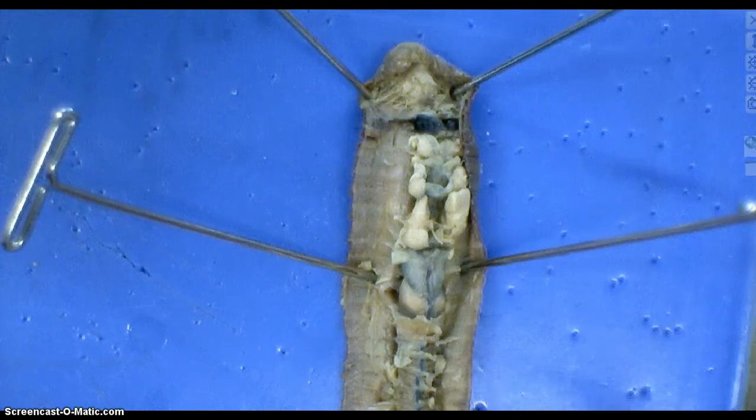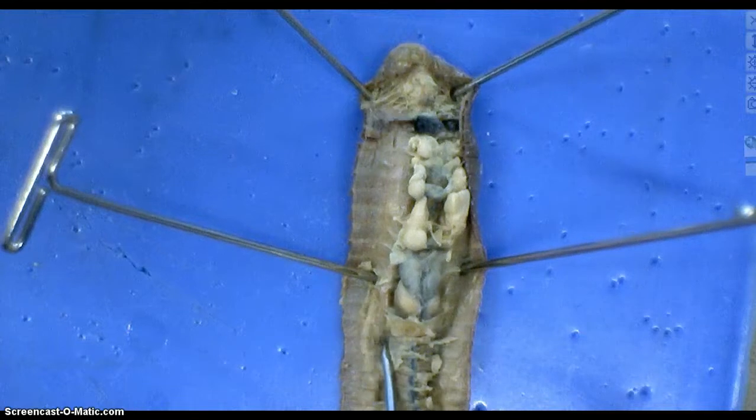And then the rest of this, like I said before, is just intestine. There's a question related to why this blood vessel would have to be this close to the intestine. Again, think about form and function — why should one thing be that close to another? What is the purpose? There are other questions on there, but this is just to get you started.